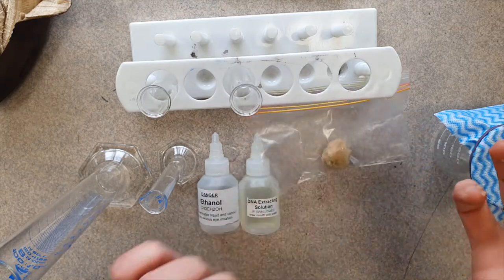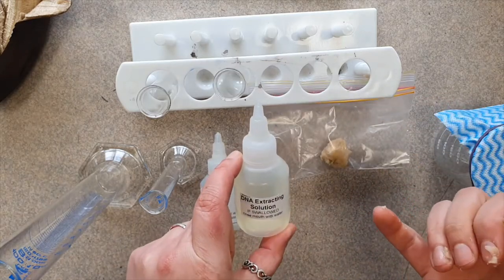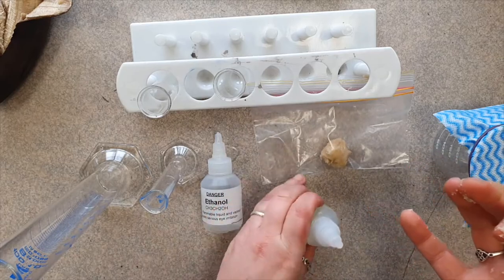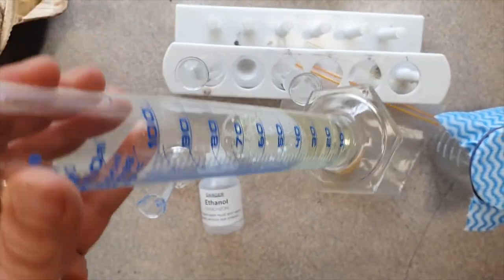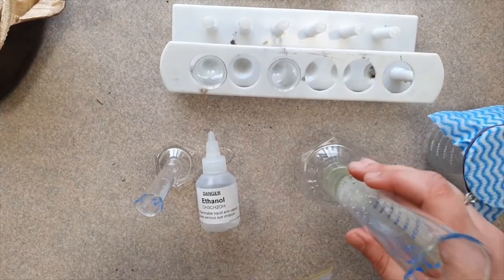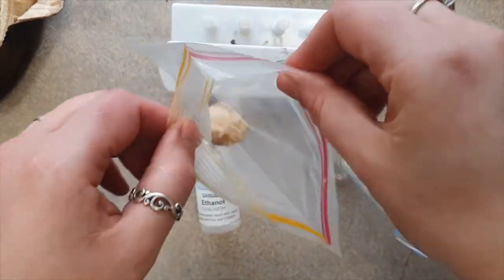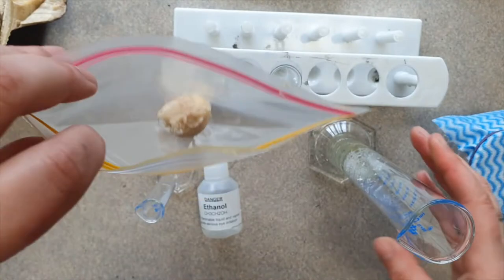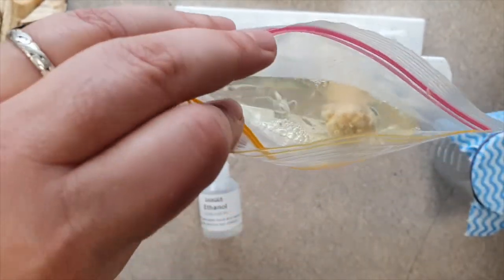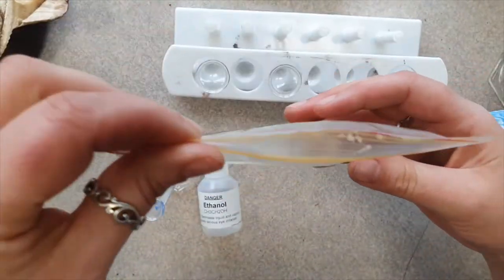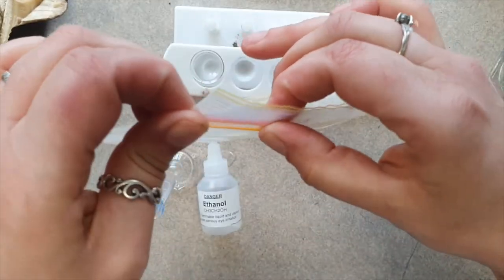Now I'm going to measure out 40 ml of the DNA extracting solution. There we have 40 ml of DNA extracting solution. Now again it doesn't really have to be accurate. You could measure out 50 ml, 30 ml. You just want to immerse it really. Now I'm going to close up the bag.